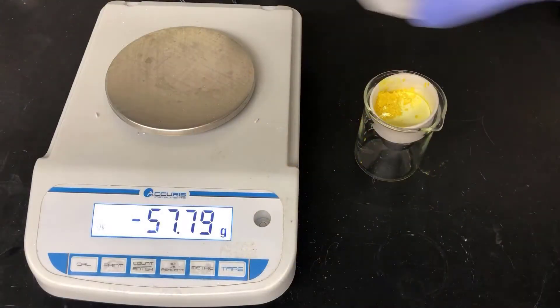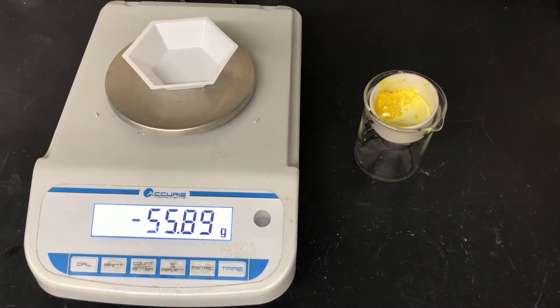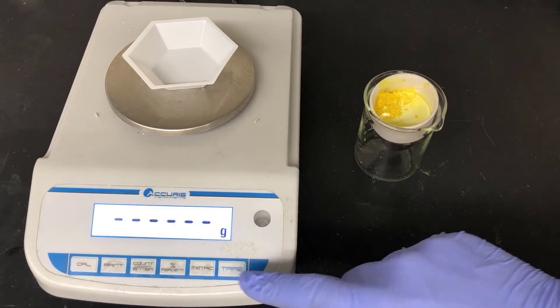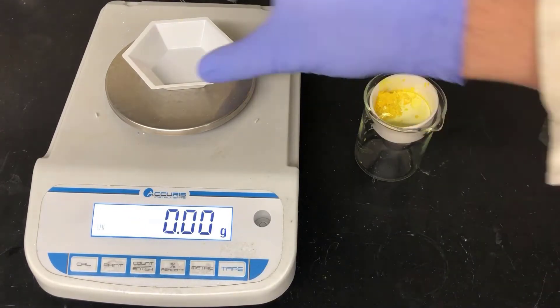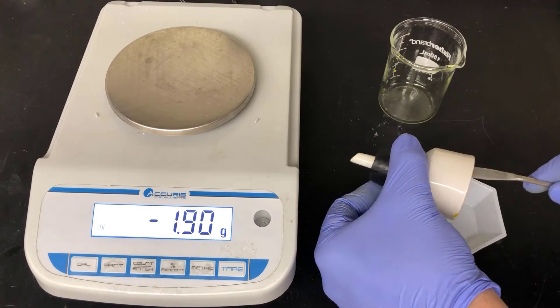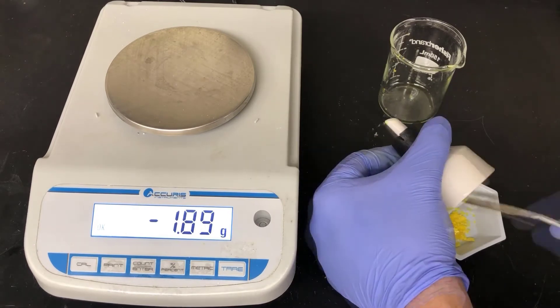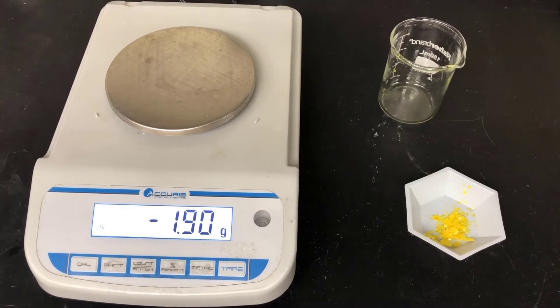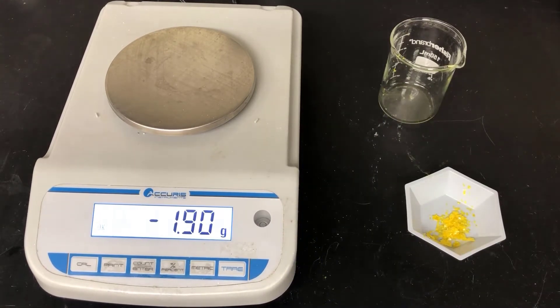Now I'll get the mass of the alkene product. I'll put a plastic weighboat on the balance, tare it out, scrape my crystals into the weighboat, and then measure their mass.